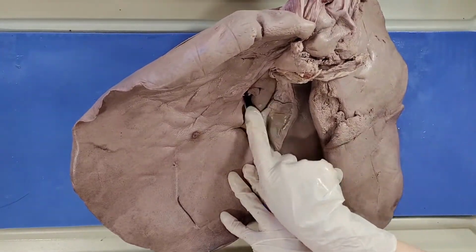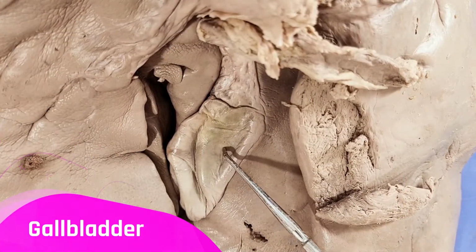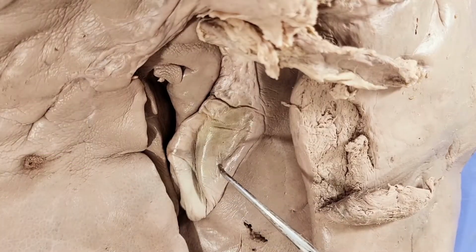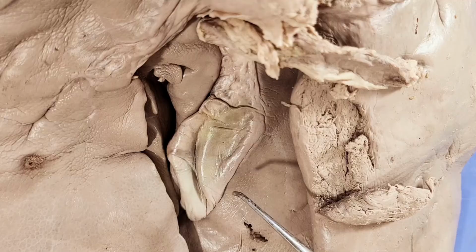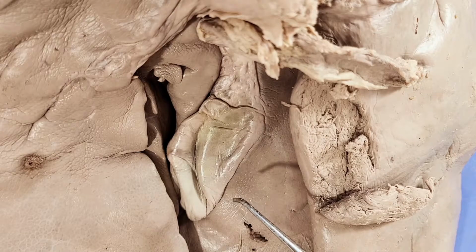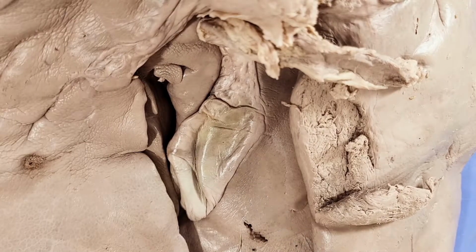So we're going to zoom in. So this is the gallbladder, which stores the bile that the liver produces. Bile is used to digest lipids. Think of scrubbing a very oily plate. The water will just wash right off the oily plate unless you have some soap to break up the oil. Bile works similarly in the digestive process, breaking up lipids so that it can be absorbed.